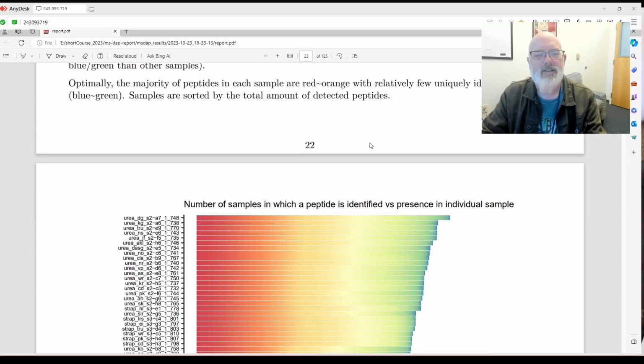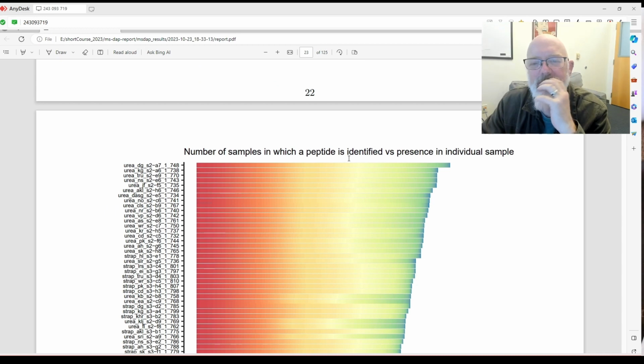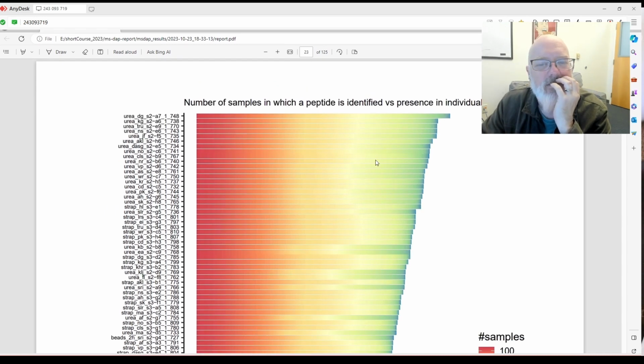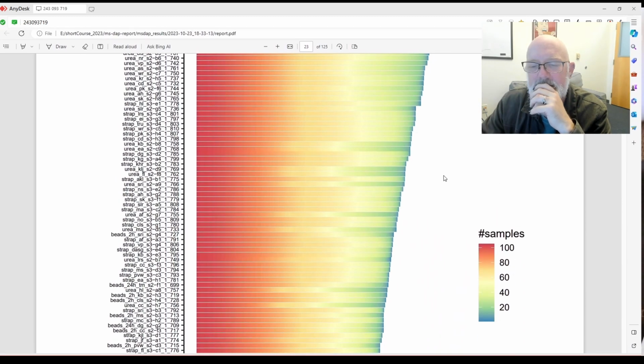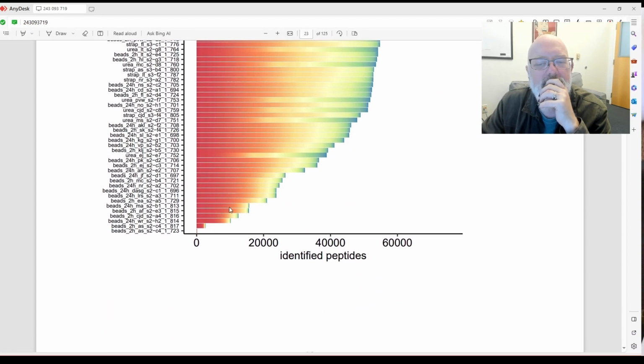Okay, peptide detection frequency: number of samples in which a peptide is identified versus presence in individual samples. Okay, I'll have to go back. Oh, number of samples. I see. So if it was red, number of peptides. I see.